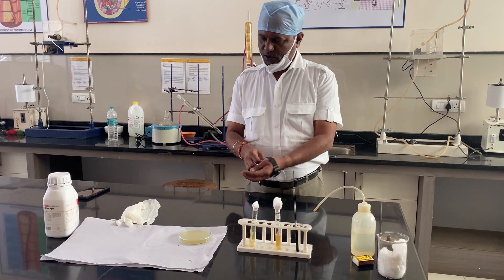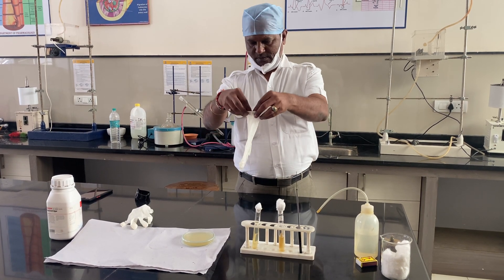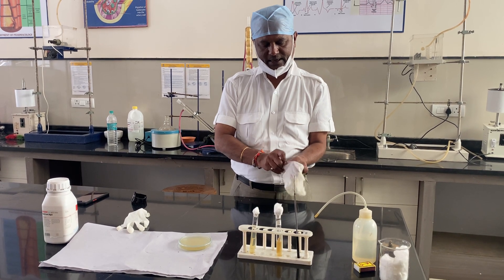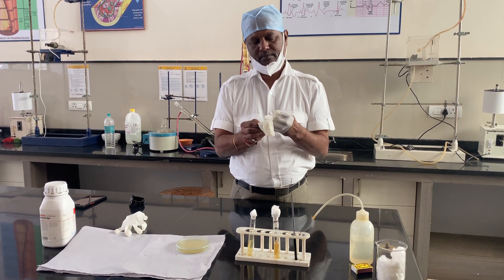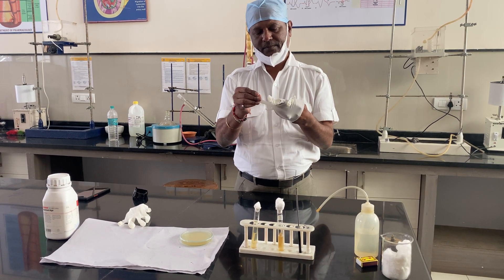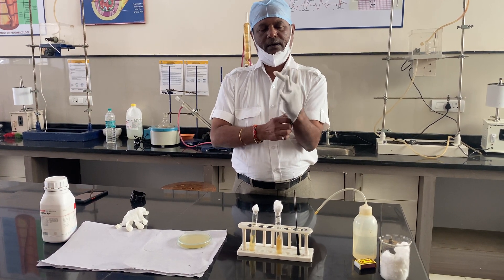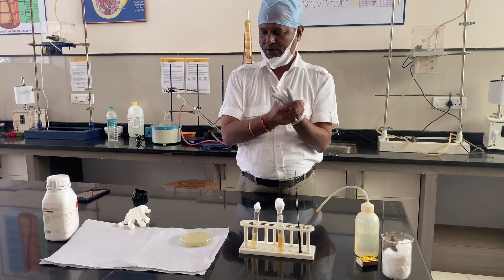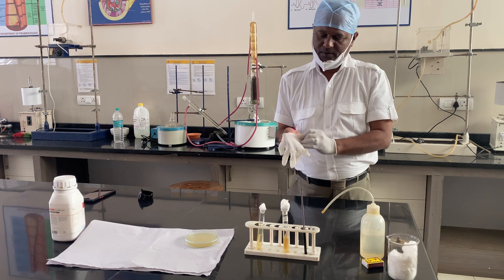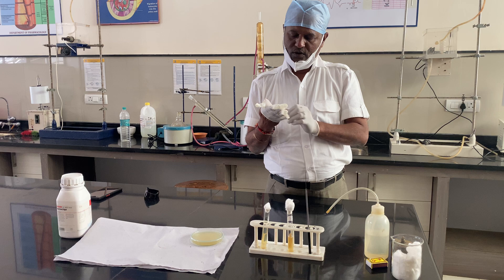Good morning friends. Today I am going to show you the demonstration for the aseptic transfer technique — how we are going to perform this aseptic transfer technique in microbiology practicals. This aseptic technique is most useful to avoid any sort of contamination, and it is one of the most useful techniques.